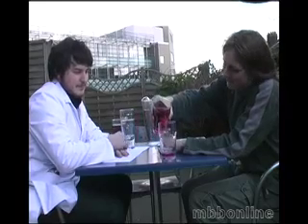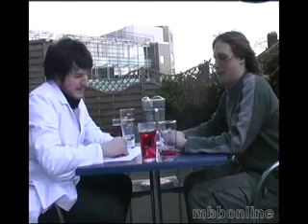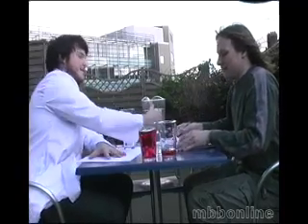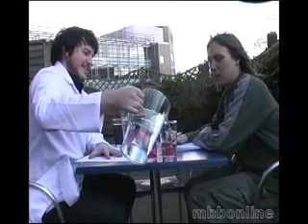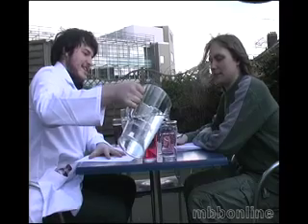Diluting away. A little bit damp there — that's why we don't do science with pint glasses. And there we go. If you look at that now, 0.5 to 0.1 to 0.01. There we go. Well done. That was easy. It was — fairly simple.